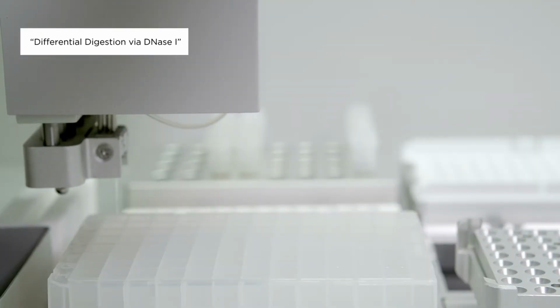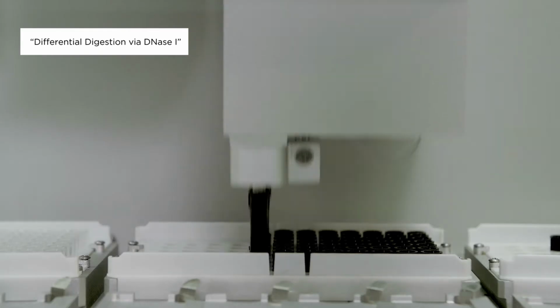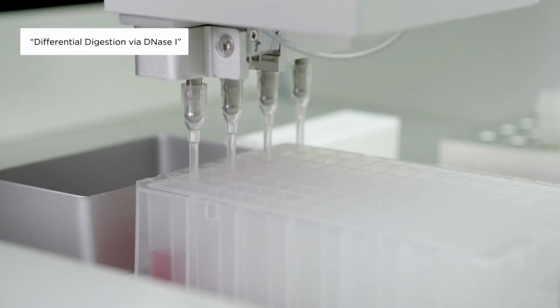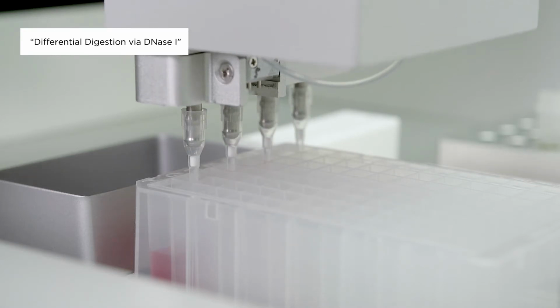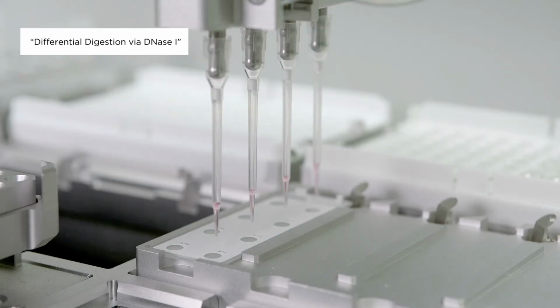Differentials, however, can vary from lab to lab. Whilst automating slide preparation may seem like an attractive notion to some, other facilities have moved on to a more streamlined approach known as direct-to-DNA. Essentially, this means diverting the manual process of examining slides and only dealing with a process known as Y screening to determine which samples have male DNA present.